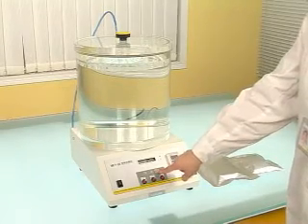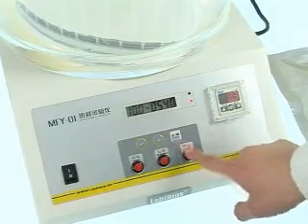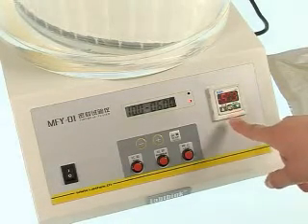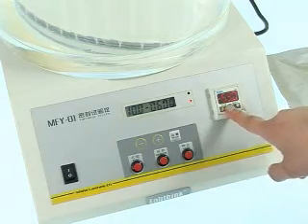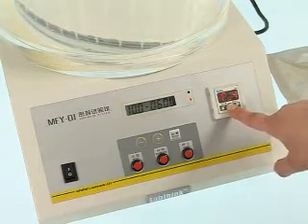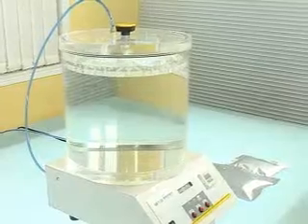Set relating parameters. Place sample into test chamber.